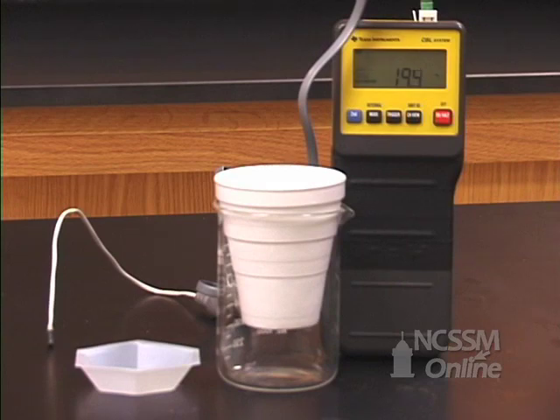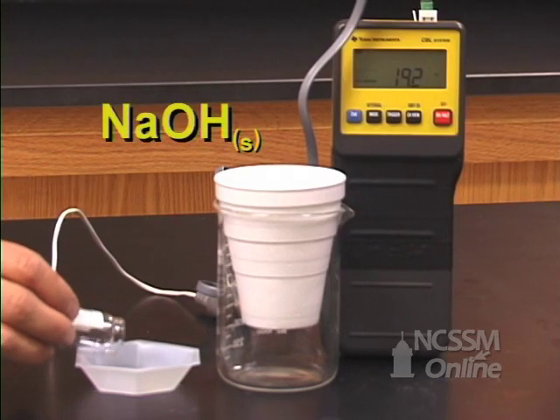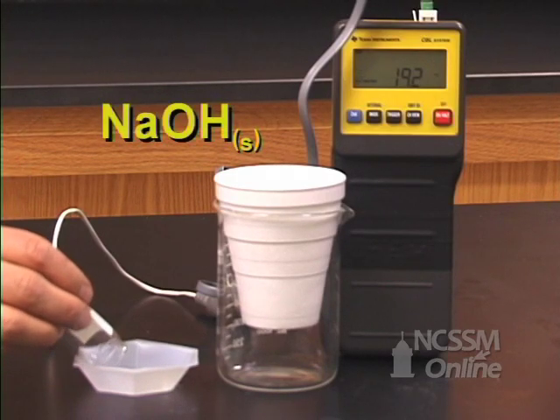In the first part of Hess's Law, we will measure the heat of solution of solid sodium hydroxide. You will mass out approximately one gram of solid sodium hydroxide.